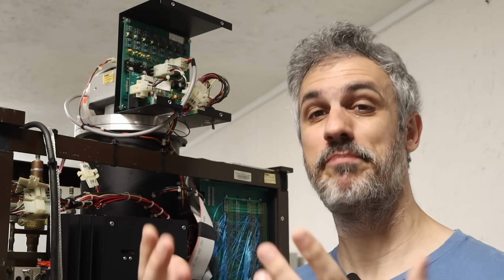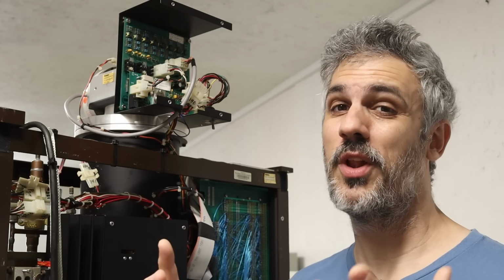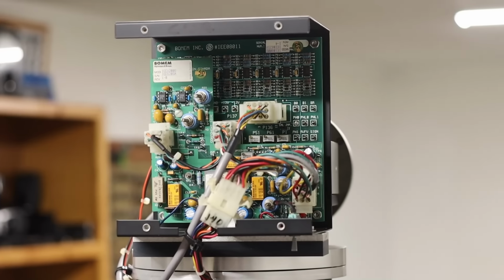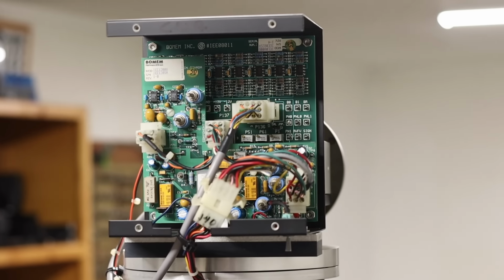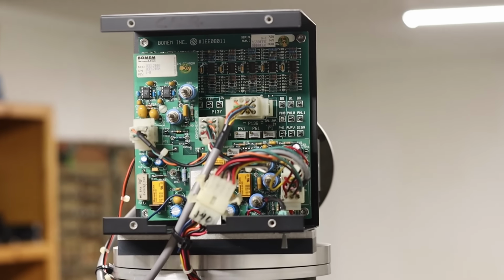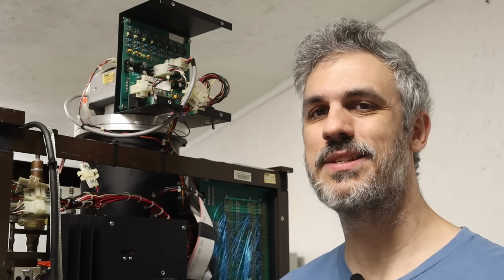And I realize it's strange for me to be talking about the moving mirror, but standing here at the back of the machine, but that's because the motor control logic for the moving mirror is all right up here in this box. And the mirror is totally fine and free to move, but it's unpowered, which means we have a fault somewhere on here. Although I don't think the fault is actually in this box.